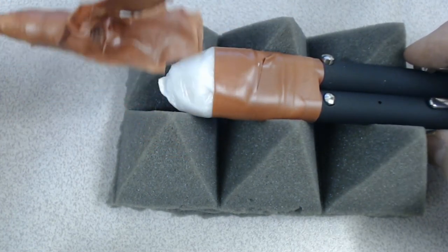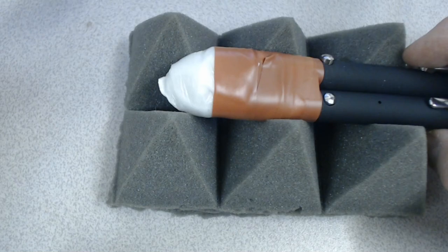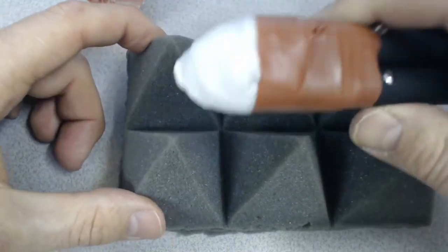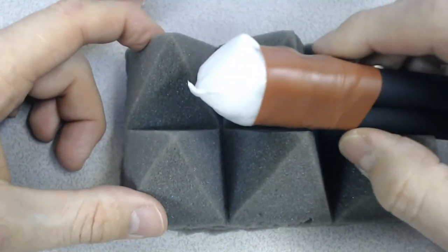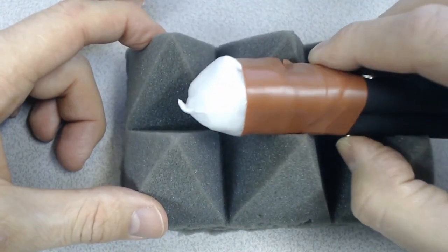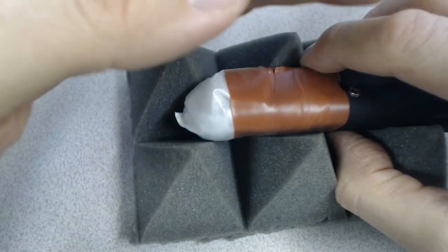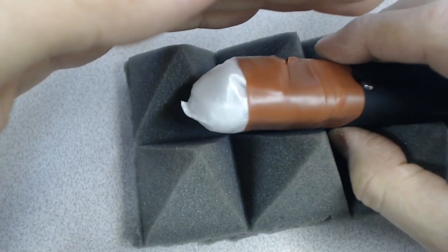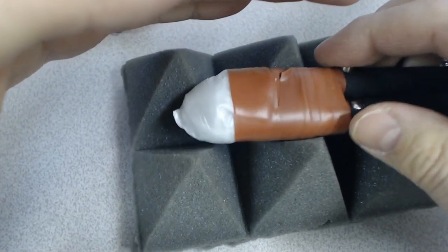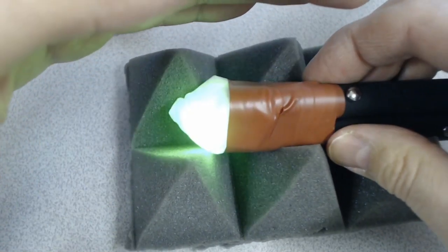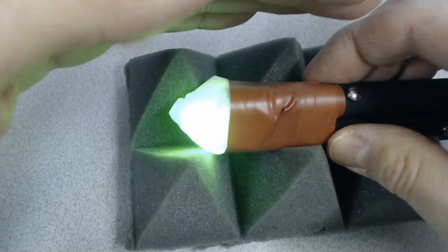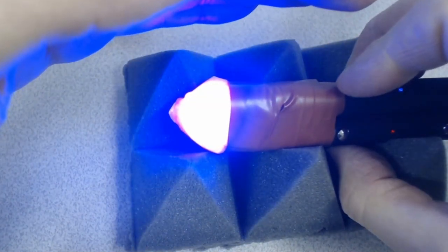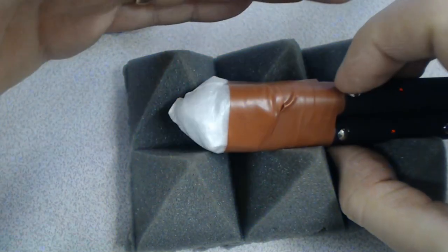And what we're going to try and do is, if I look here, you can see there's a red, there's a green and the green is extremely bright, and there is a blue.